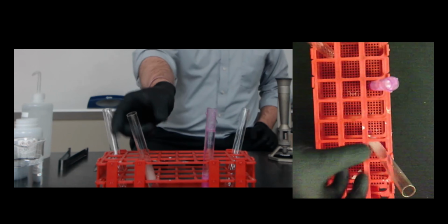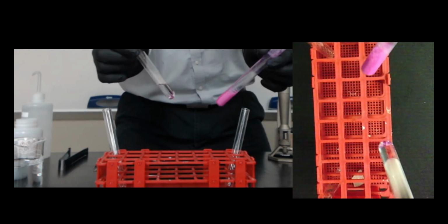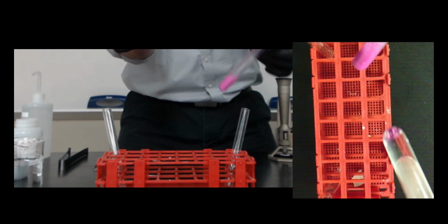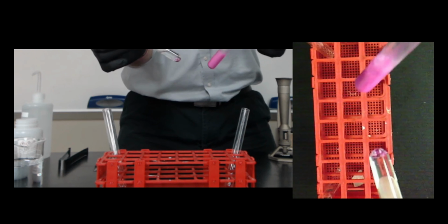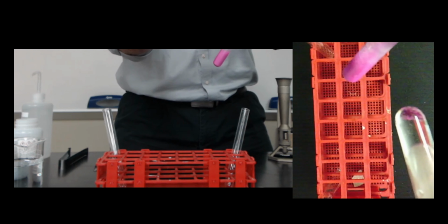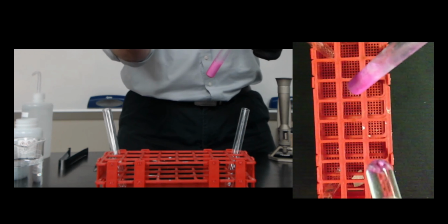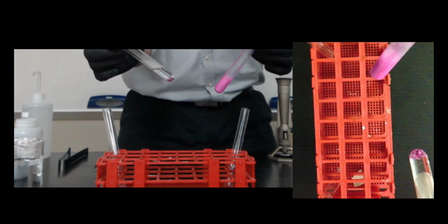Okay? So again, if we look at the color change, clearly the calcium reacted faster than the magnesium. If you just look at the difference in colors, this one is definitely purple. This one you can kind of see right at the bottom. It's starting to change purple, but not very quickly. Okay, here is calcium, this is magnesium. Clear color difference between them.